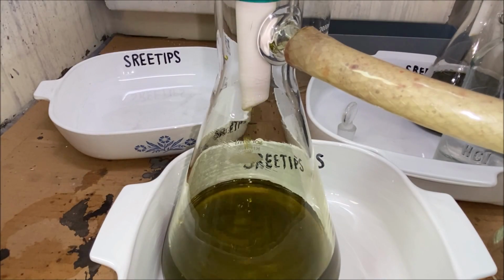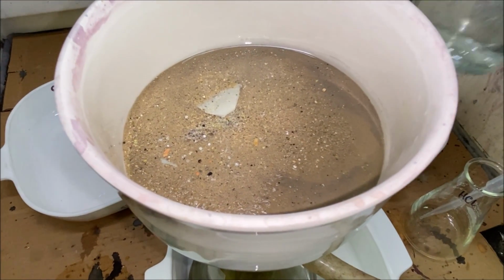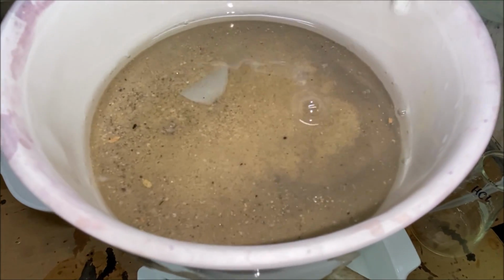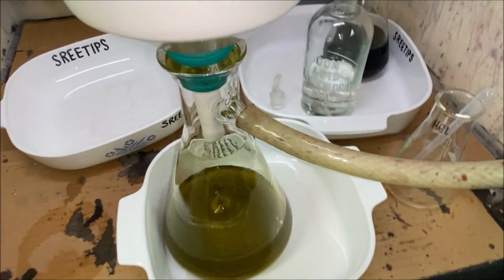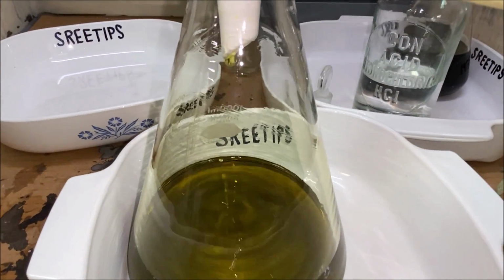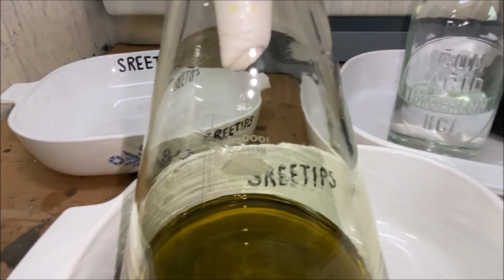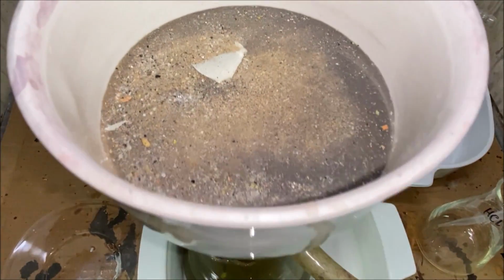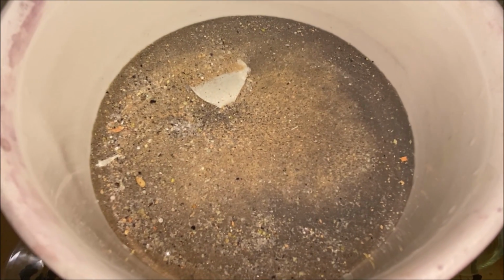Now the filtrate coming down out of the funnel looks a little bit yellow colored. So what we'll do is we're just going to pour some hydrochloric acid in here and rinse these solids out until we get a clear filtrate coming out down here. Our filtrate is running clear now. I think it's safe to conclude that we've got all the precious metals pulled out of this filter now.